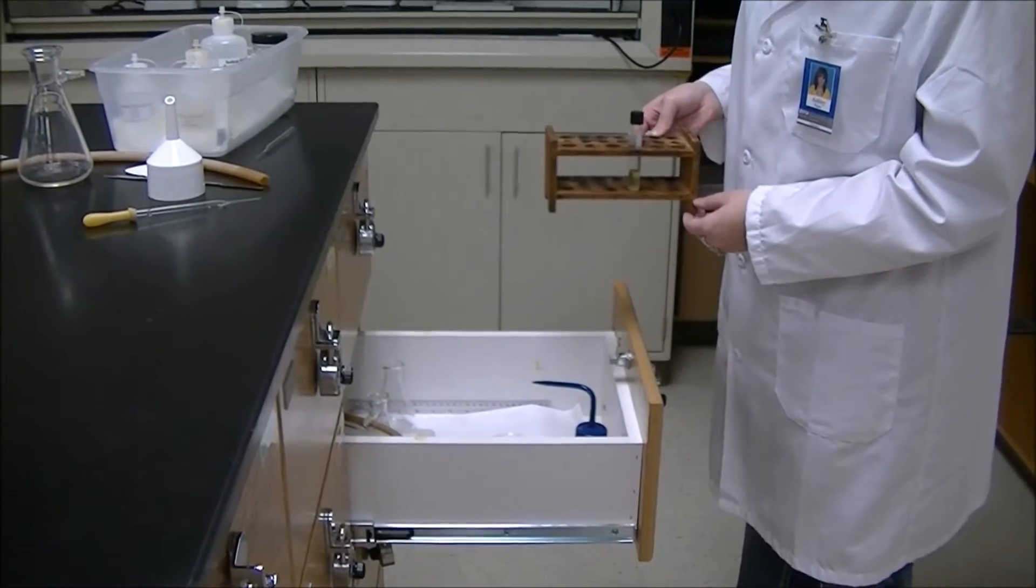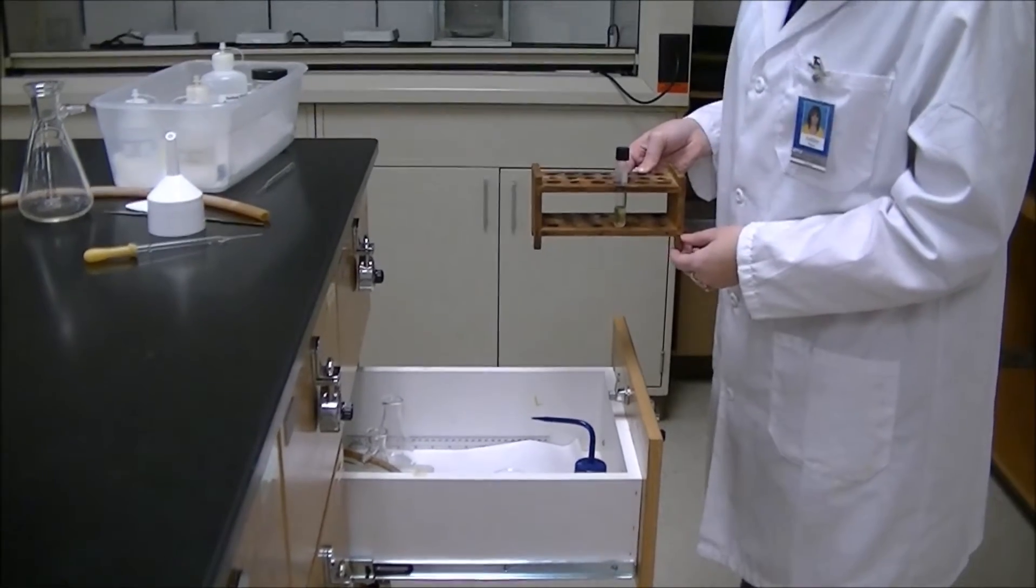We'll get the 9-fluorenone out of the ether layer still in the tube later, so make sure you put it somewhere safe.